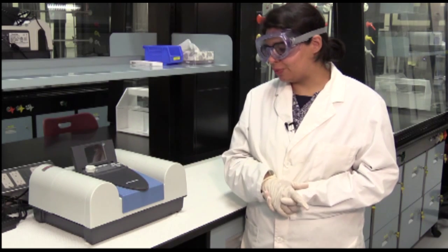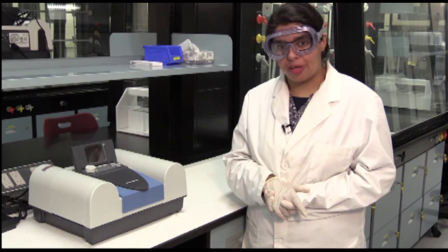So in our particular lab, we'll be using this model, which we call the Spectronic 200. We also call it a spec 20, or just a spec, but they all mean the same thing.